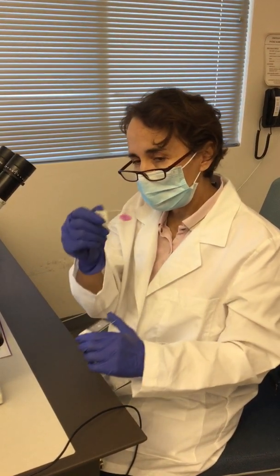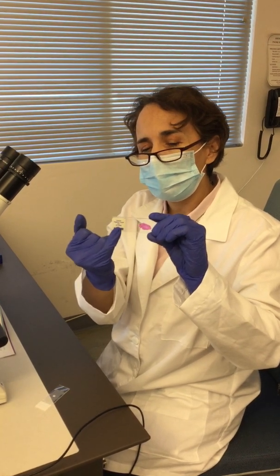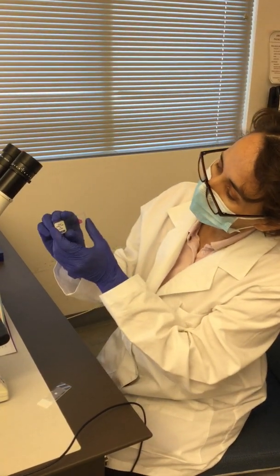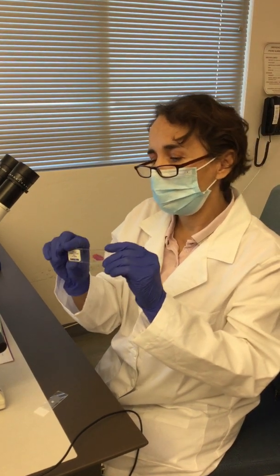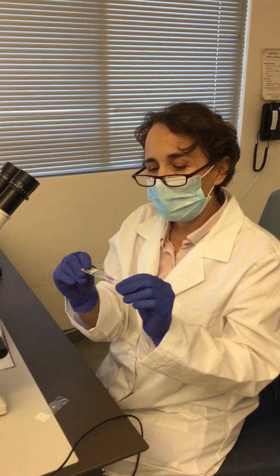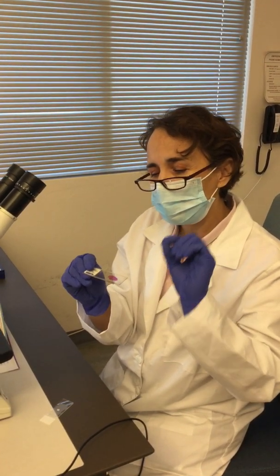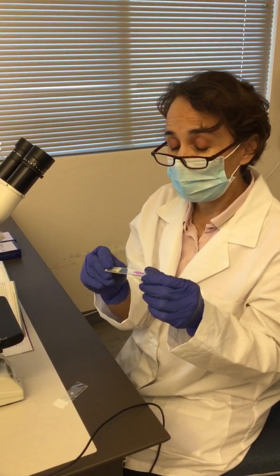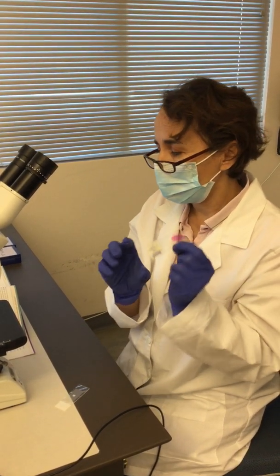In this case, this is a prepared slide. If you see, they have this sticker with the identification, which in this case says human palatine tonsil, and it has the name of the company, etc. But this is the top of the slide, and you see this other piece, this is a cover slip, which is a very, very thin part of the slide that goes on top of this. So you can use that as well. And here is the sample, so you always focus on where the sample is.